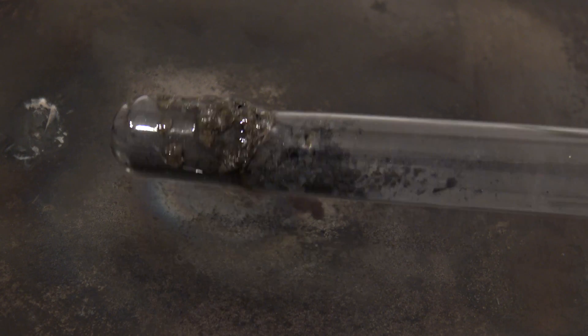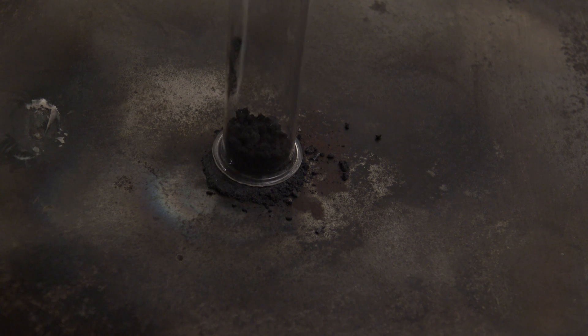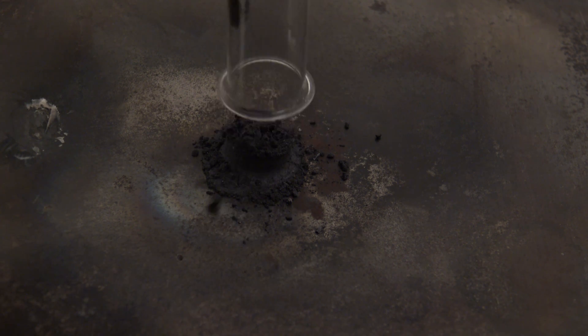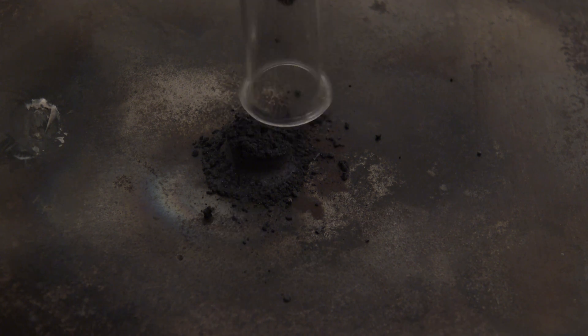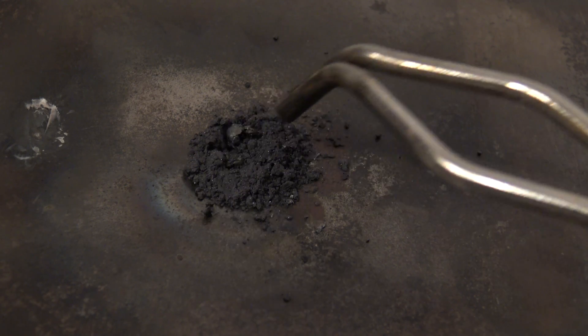After cooling down, it becomes visible that not all the silicon had reacted. Most problems affecting the quality and yield can be solved by increasing the amount of the reactants or by doing the reaction in a crucible. This was not needed in my case.